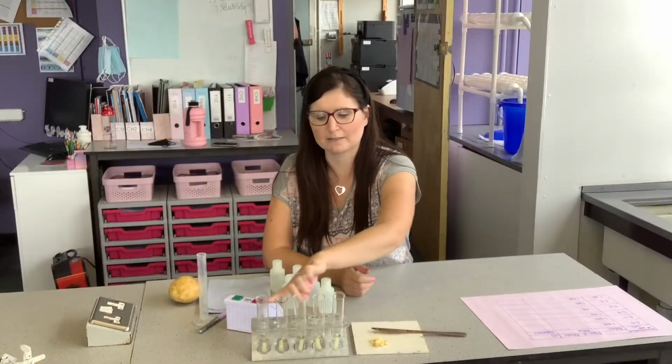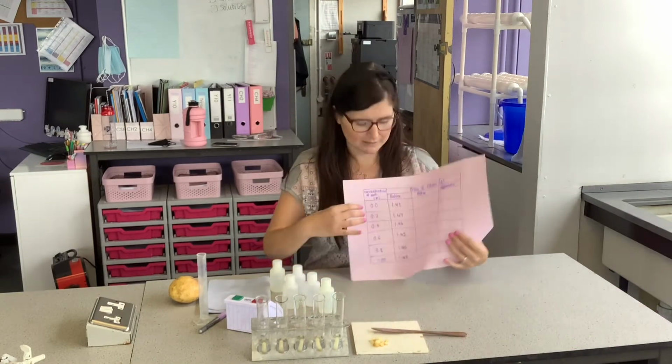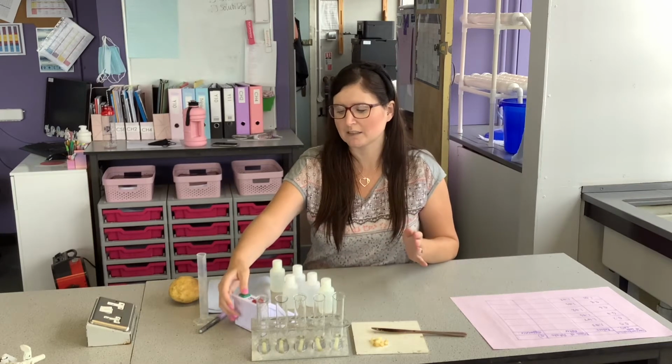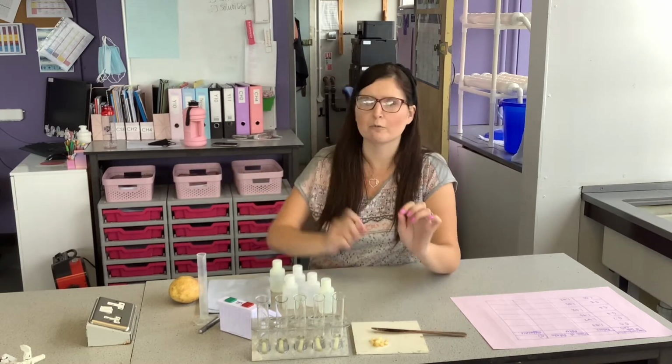Once I've weighed the mass of all my potatoes and popped them in the salt solutions, I recorded them in the table, so as you can see, I have all of my before masses. Then we're going to time around 30 minutes because it's going to be a slow process. So start a stopwatch and we'll time for 30 minutes. Then when we come back, we're going to take the potatoes out and re-weigh the mass of the potatoes.